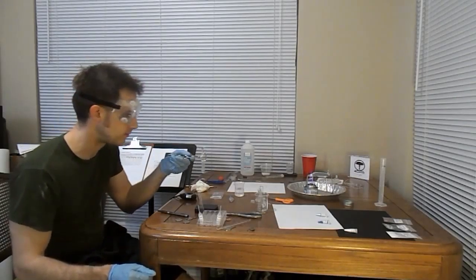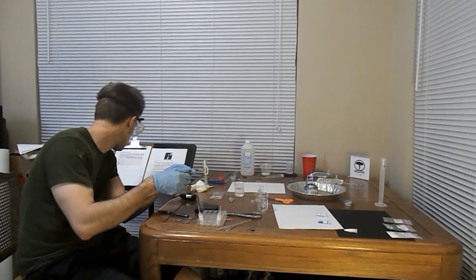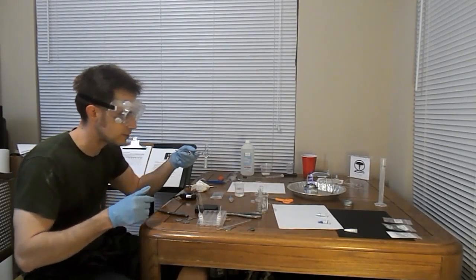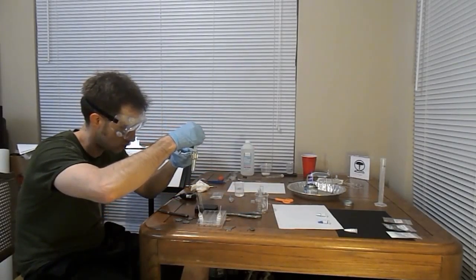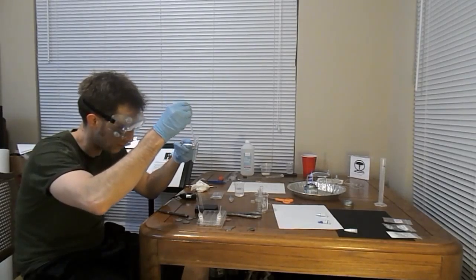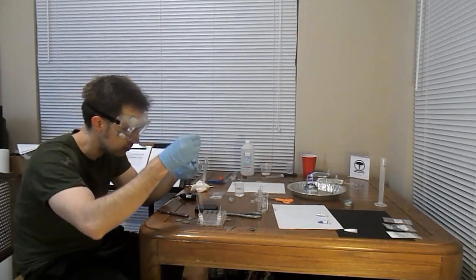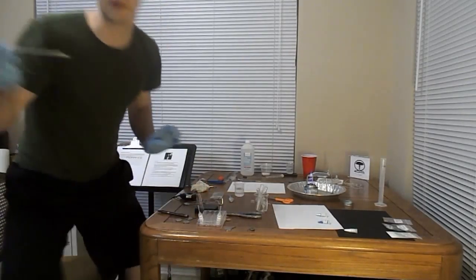So yeah, I'd say something happened, that's for sure. I guess I'm supposed to stir this, so here we go. Can't see that really made a difference at all. I'll go ahead and put that in a little container of test tubey stuff and rinse this off.